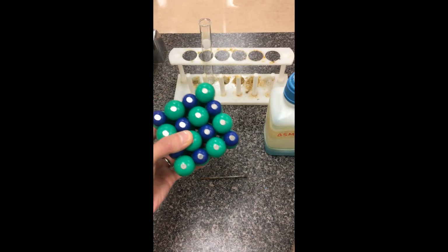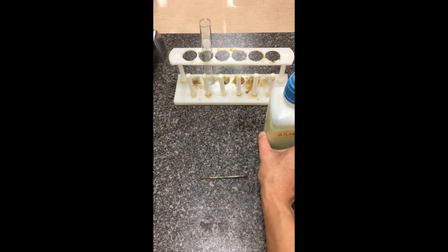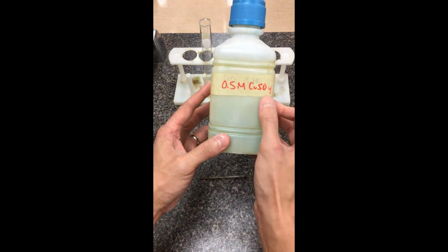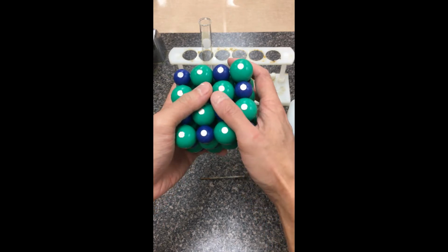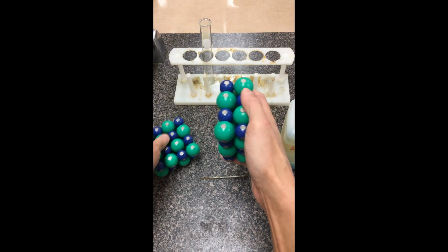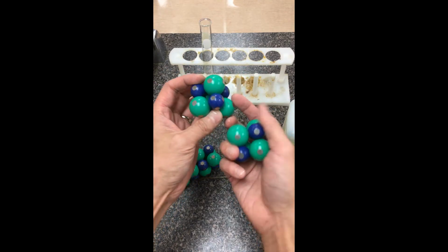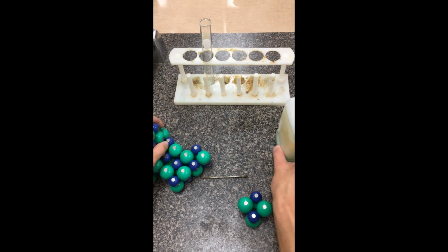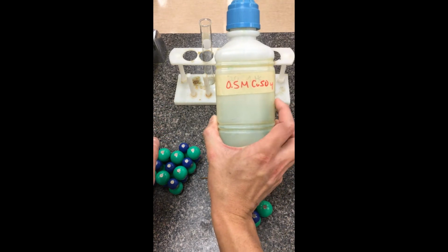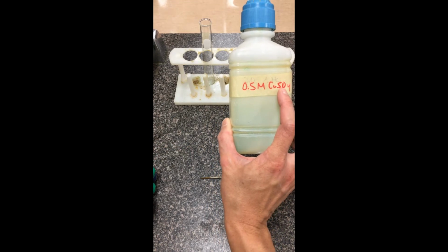For this reaction, we've taken the copper sulfate and added some water to dissolve it down. The concentration of this one ended up being 0.5 molar copper sulfate. Because this ionic compound got dropped into water and is soluble, it completely ripped apart. It started falling apart. All that water that used to be in the pores when it was in solid form is gone. So in solution, this is just a pure solution of copper 2 ions and sulfate ions. That's what we're going to be starting off with in this reaction.